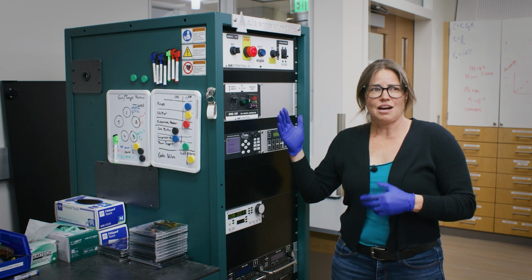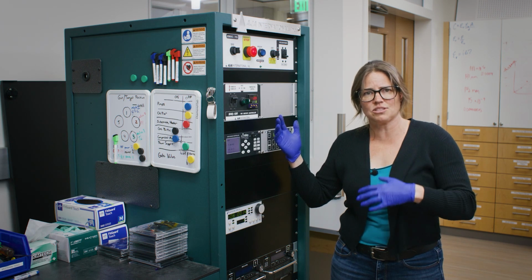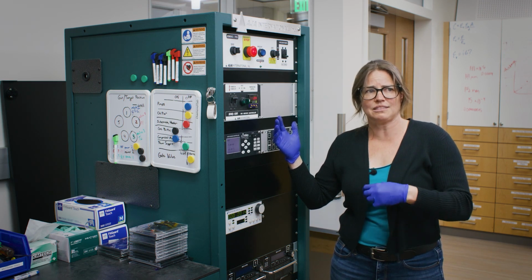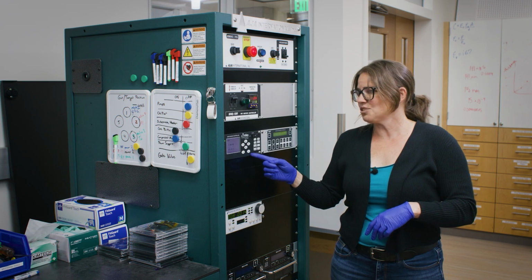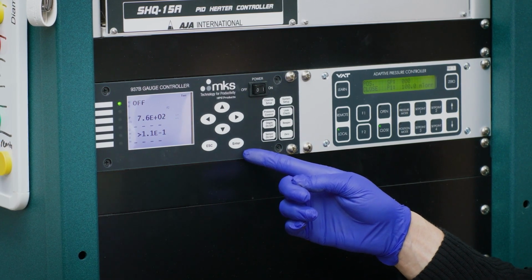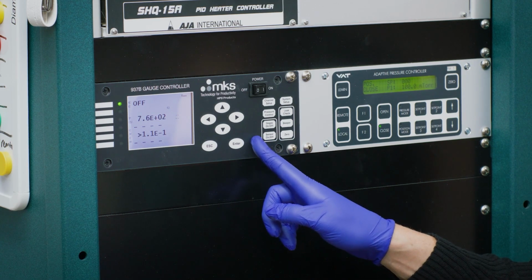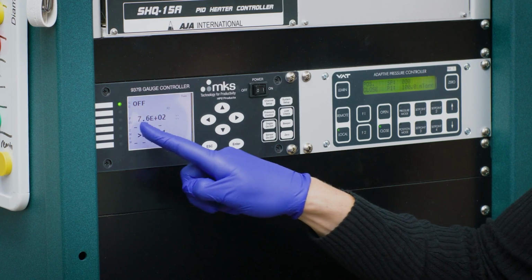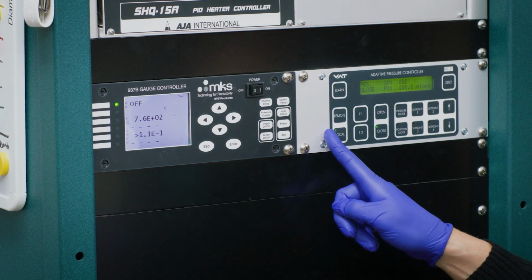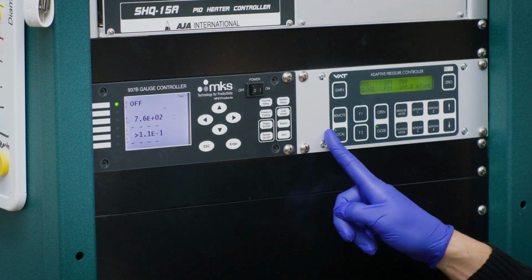This is a high vacuum system. So we have two different types of vacuums, a mechanical pump to bring us the first step of the way in how much air we can pull out, and then a turbo pump that takes us the rest of the way. That means we have to use three different types of gauges to get to the different levels of what pressure we are at. And right now we're on this gauge in the middle here that tells us that we're sitting at atmospheric pressure. This controller right here controls the gate valve to the big silver vacuum chamber we just loaded.